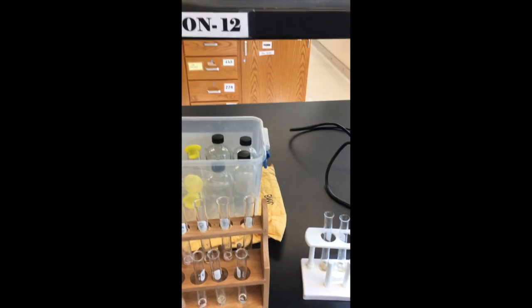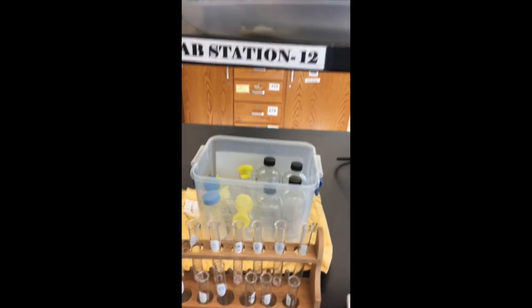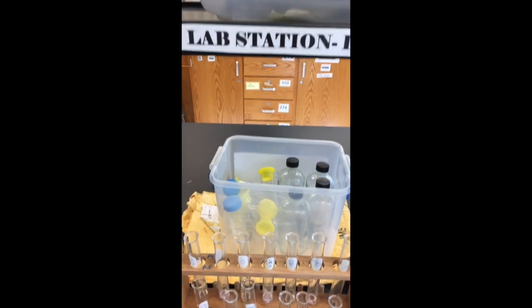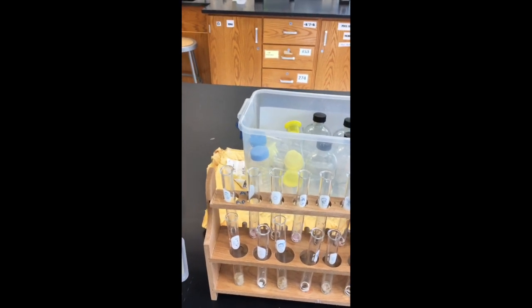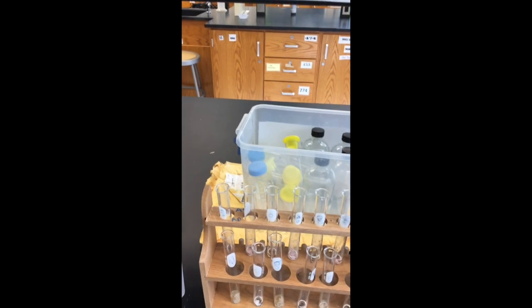I'm gonna put a certain number of drops in each one of the 4 test tubes to test whether or not they have protein in them. Now, in so doing, I'm going to have to put down my phone, so I will apply the drops, and then I will record for you what kind of results I got.